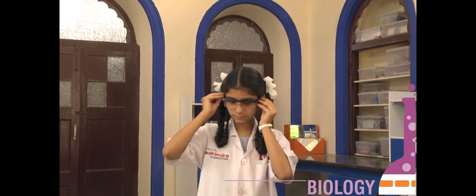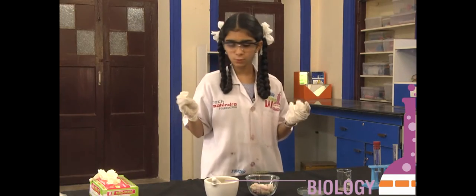Before starting the experiment, we should take some safety precautions. We should wear safety goggles and gloves. Now, let us do it.